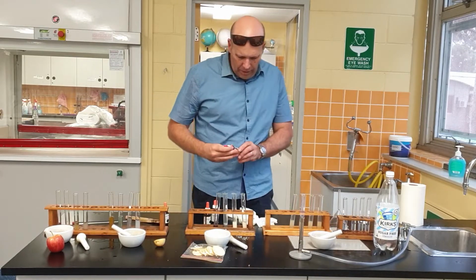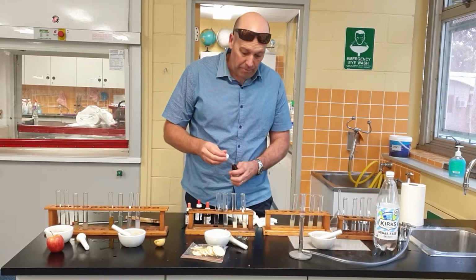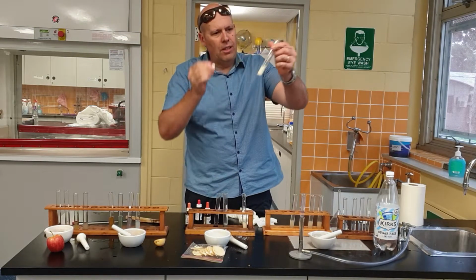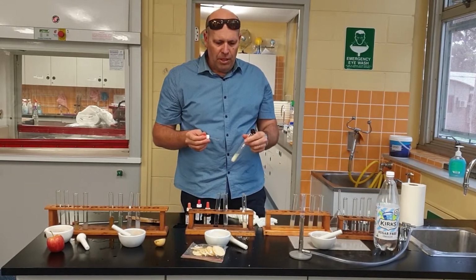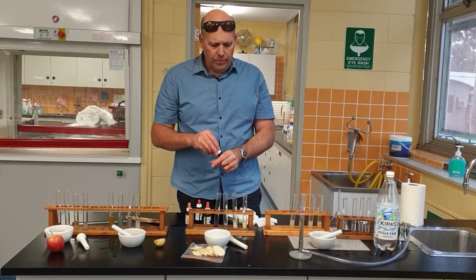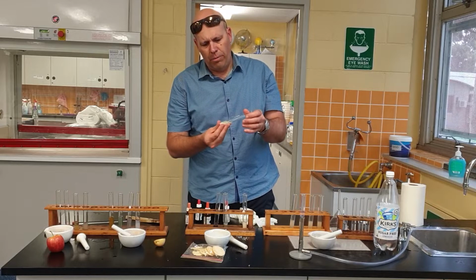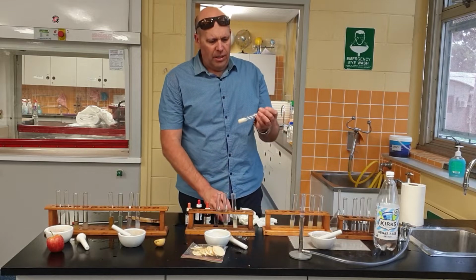Now protein. I forgot to actually get you guys to do a check to see whether you could predict whether it actually did. But this is where it gets a little bit hard because you can see it's already a white colour, but it has actually gone a bit cloudy. Sorry, I've actually got it wrong. It should actually go purple, shouldn't it? It should go purple if it's got protein. Has it gone purplish? There's a little bit of a tinge there. I don't know whether it does, but this one's going to be a bit hard.